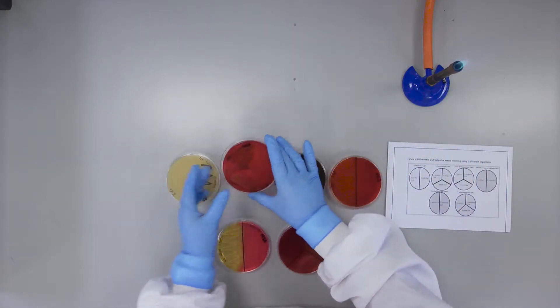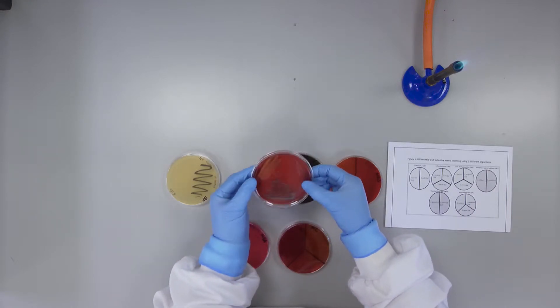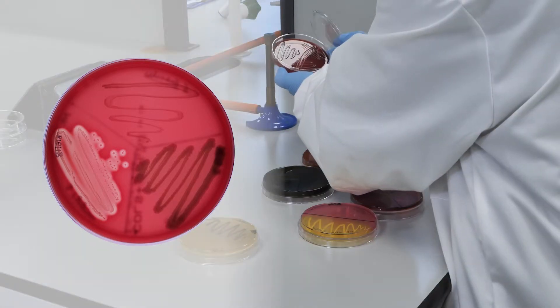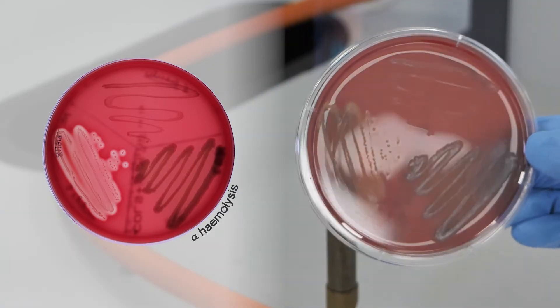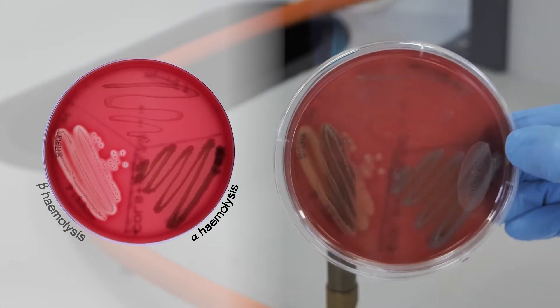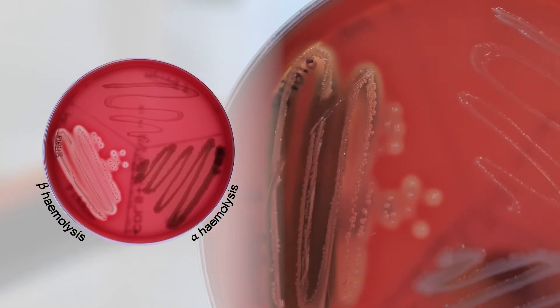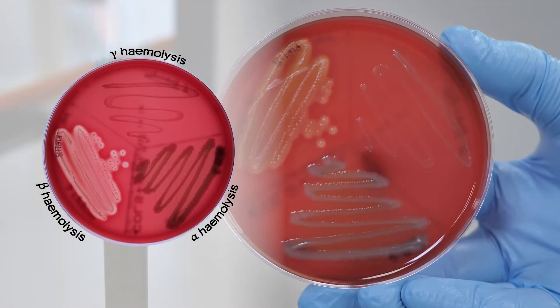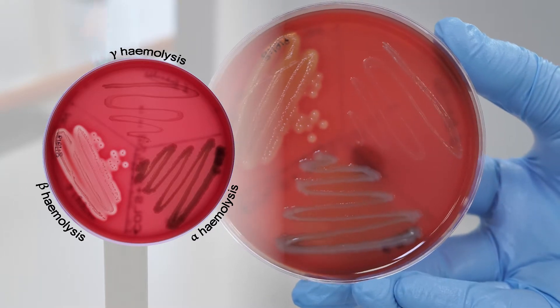Columbia blood agar is a differential and enriched medium. It distinguishes between hemolytic and non-hemolytic species. There are three types of hemolysis. Alpha hemolysis is shown by a green or brown discolouration in the medium. Beta hemolysis is shown by a clear zone surrounding the growth. Gamma hemolysis indicates the lack of hemolysis; there is no reaction in the surrounding medium.